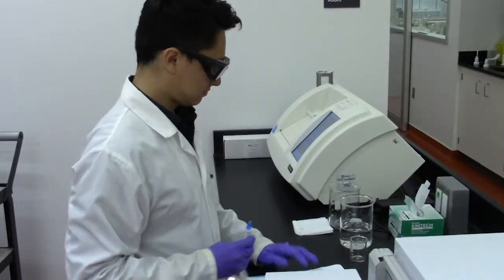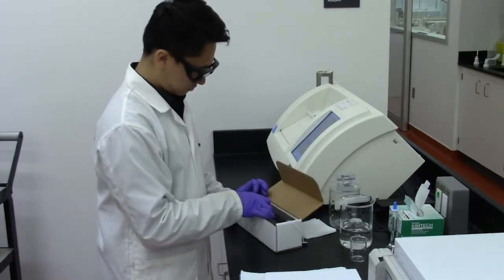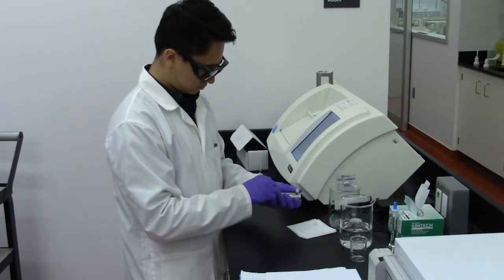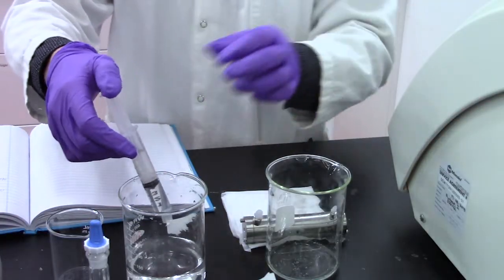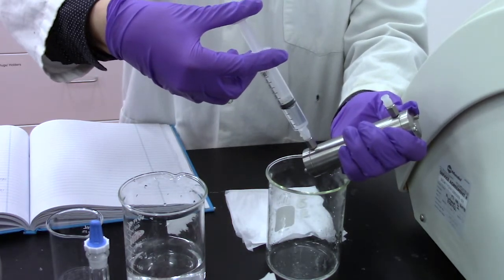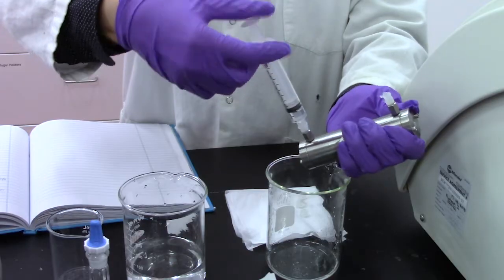In order to find the optical rotation of your substance, you must first calibrate the automatic polarimeter. To do this, fill the sample holder using a syringe with deionized water. Draw out deionized water and insert into the proximal end of the polarimeter sample holder. As you begin injecting the fluid, be sure to maintain an angled orientation of the sample holder. That will help to ensure no air bubbles will be present. A waste beaker should be placed under the distal end to catch any spillage coming out.